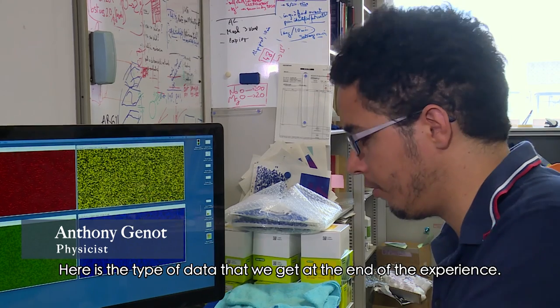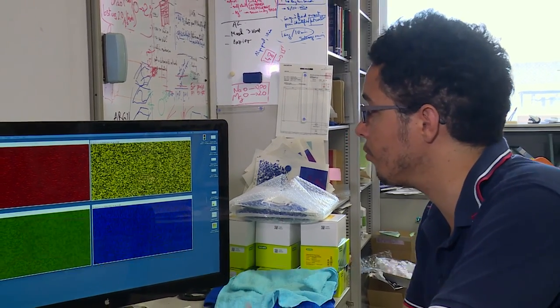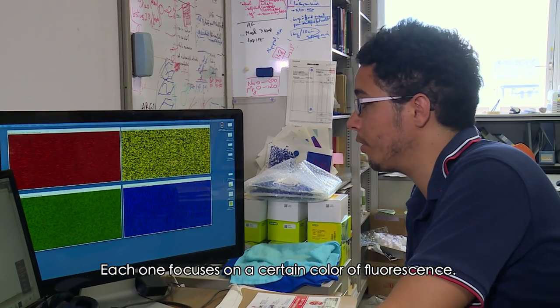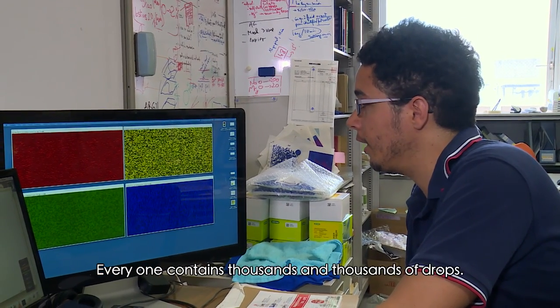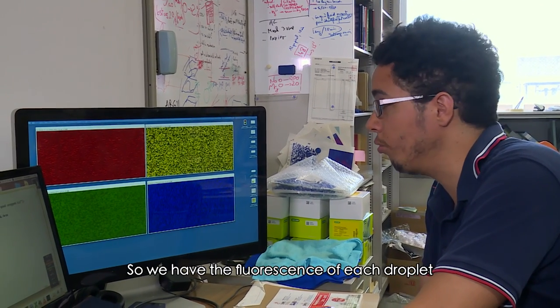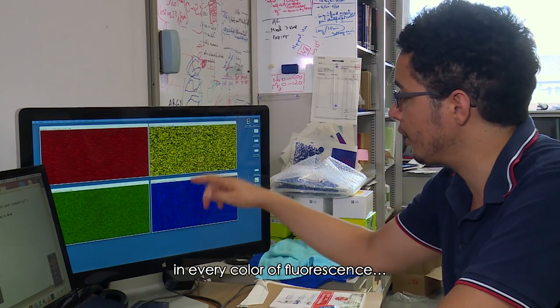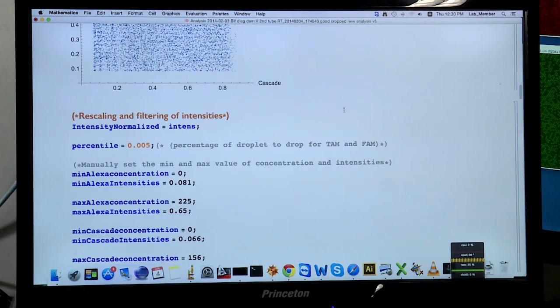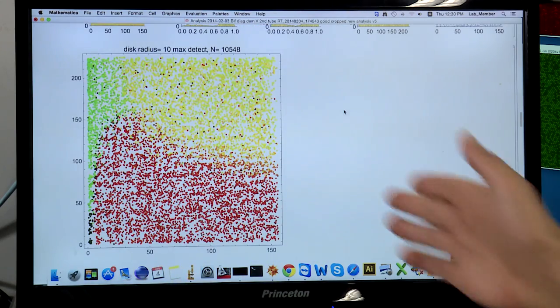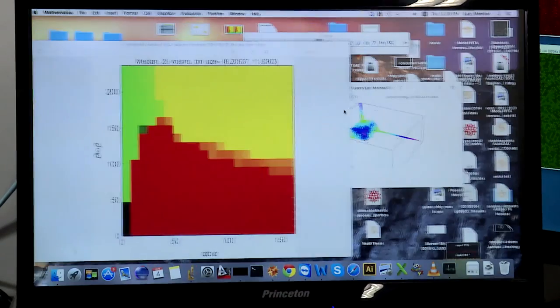Here are the types of data that we get at the end of the experiment. These are the microscopy images. Each image corresponds to a fluorescent color. As you can see, each image contains thousands and thousands of droplets, giving the fluorescence of each droplet in each fluorescence channel. After mathematical processing, we get a diagram that sums up the evolution of the DNA in each droplet.